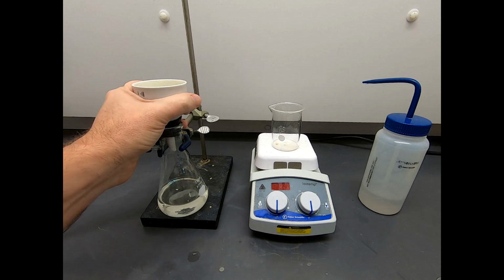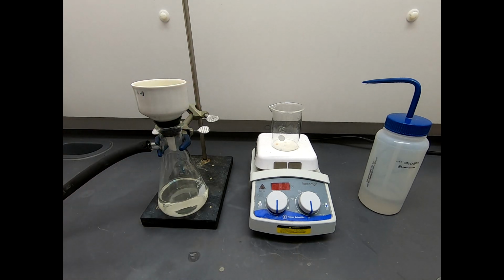I'm going to let this dry a little bit, but based on the TLC, we kind of expect to see some impurities in here. There are at least 2 impurity spots. There might be a speck of starting material left over. So we will need to recrystallize this, and the procedures that people follow for this reaction do indeed involve a recrystallization. So that is the next step.